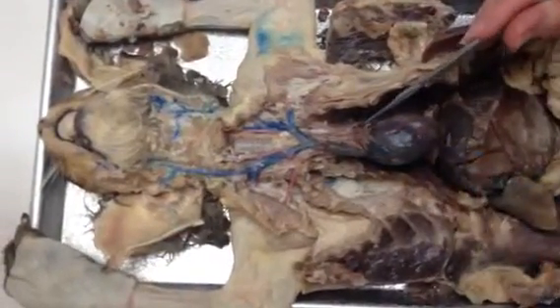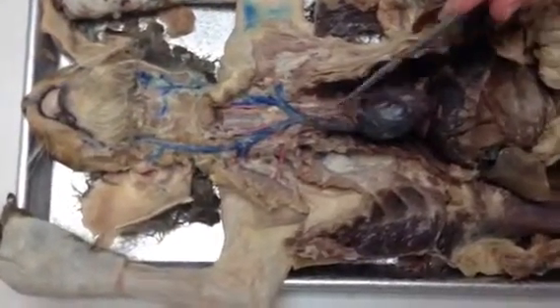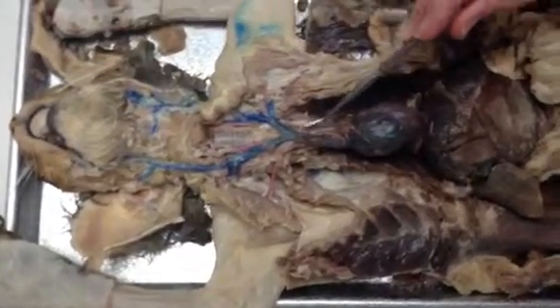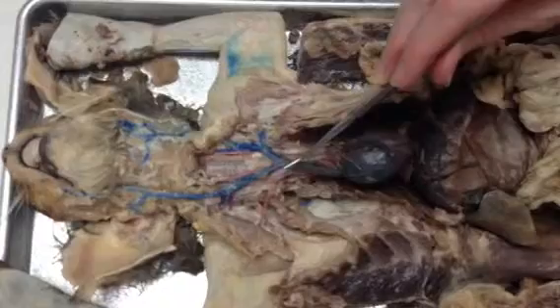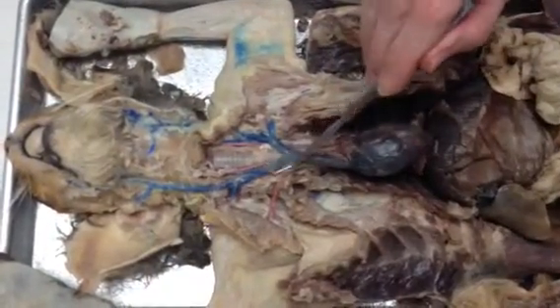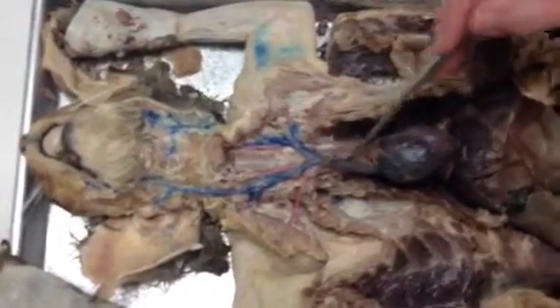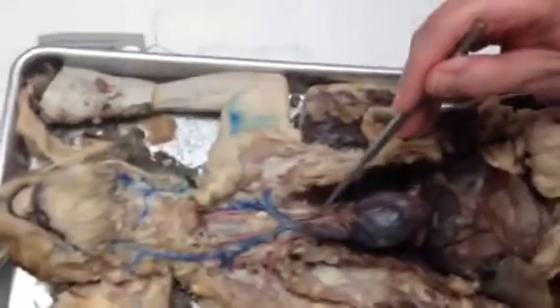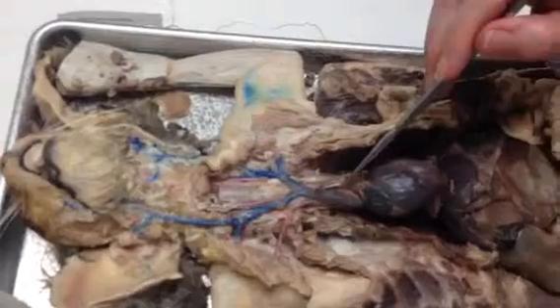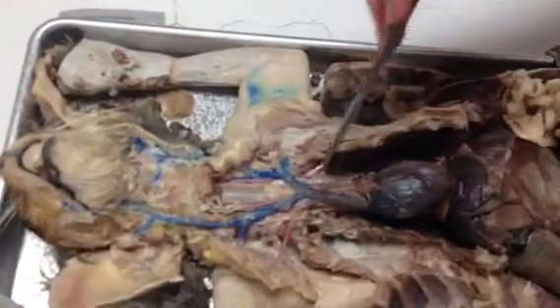Now, off of the top of this aorta is your brachiocephalic artery, which is right here. The brachiocephalic artery is going to make two branches, and those branches are the right subclavian and the right carotid. And the left. Oh, yeah, there's the left too. The left is right here. The left carotid's coming off of the brachiocephalic. So off of the brachiocephalic, one more time, we have the left carotid, the right carotid, and the right subclavian.